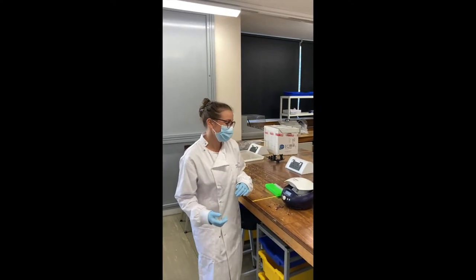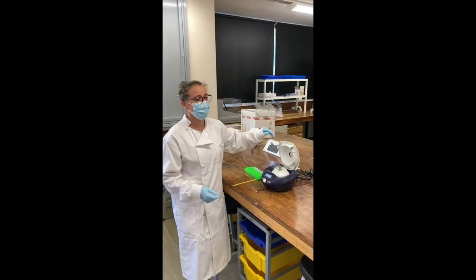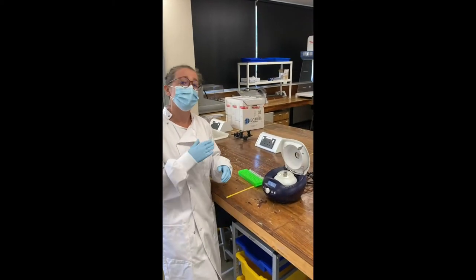Hi guys, I'm going to talk through with you today how to use the centrifuge. You use centrifuges in certain practicals where you have to pellet out a sample with liquid with it.